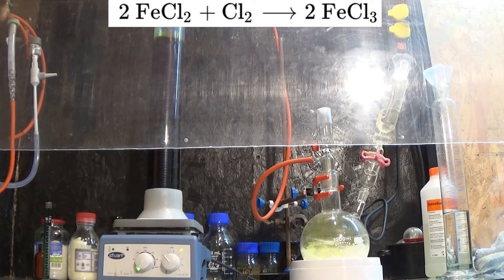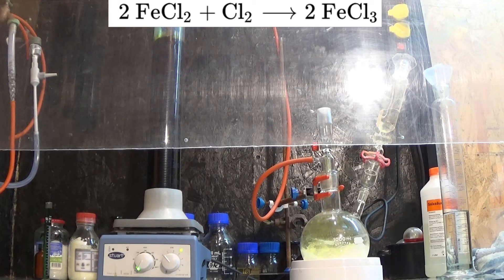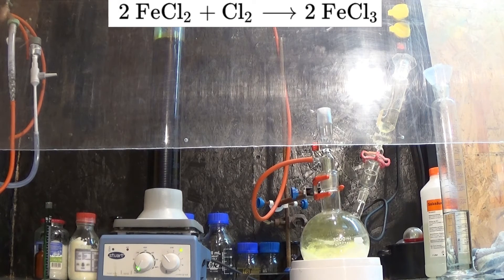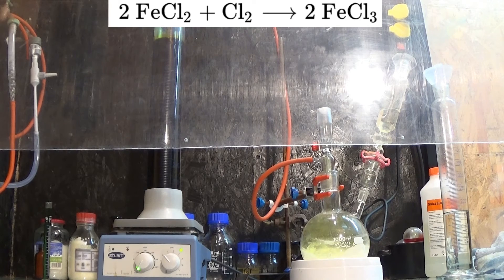So there you have it, your high concentrated iron 3 chloride solution.